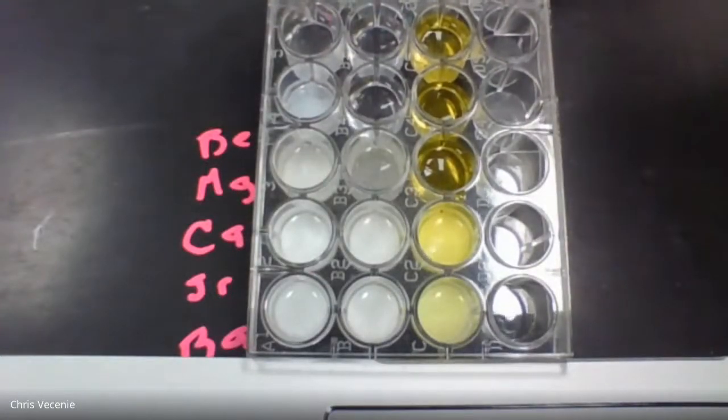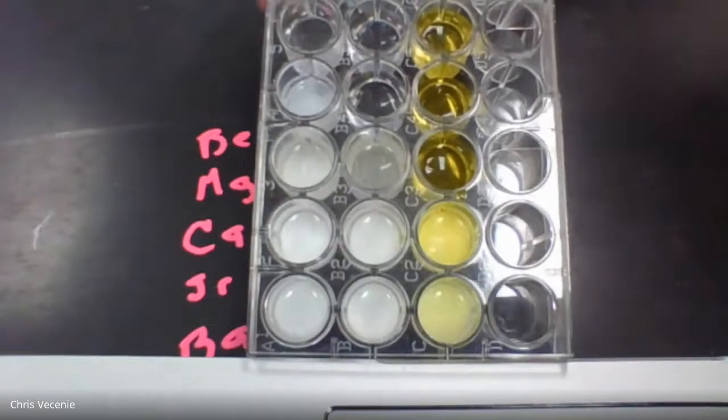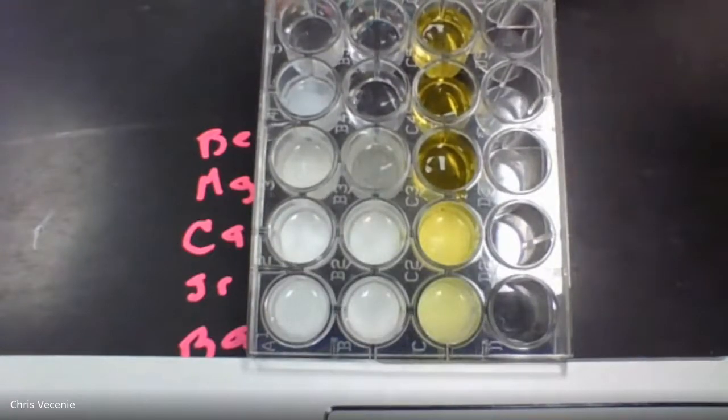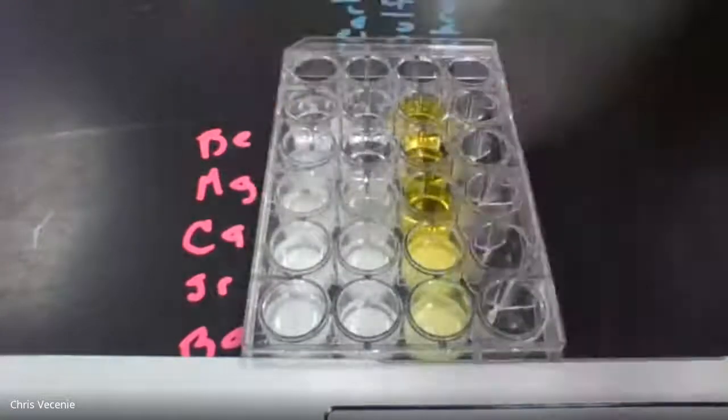Once you fill in those tables, you're going to have to add 1 column to the top, because that was just an old lab that I used. In class, I would always have you add the beryllium column at the top because it just had the 4 metals in it. Hopefully you made your observations on those.